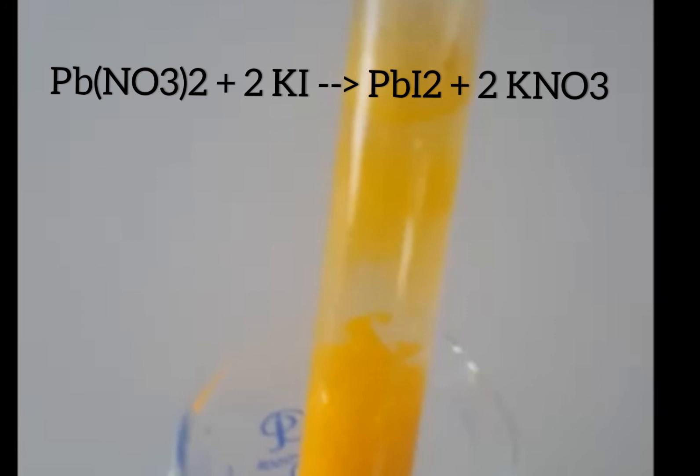We need to write a chemical equation for this reaction. Lead nitrate is written as Pb(NO3)2 and potassium iodide as KI. Pb(NO3)2 reacts with 2KI to give PbI2 (lead iodide) as a yellow precipitate, along with potassium nitrate, KNO3, as an aqueous solution.